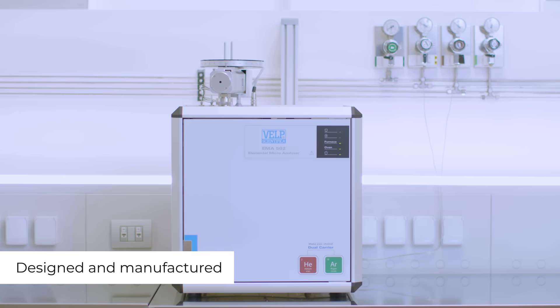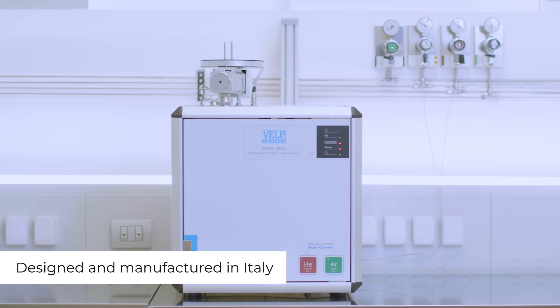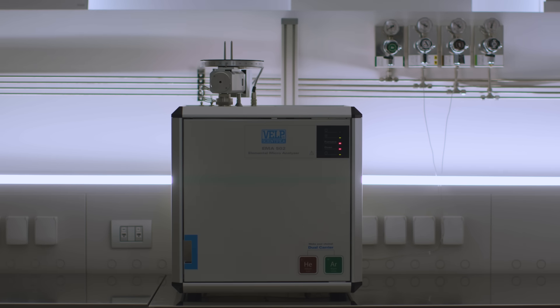VELP Scientifica EMA502 is the elemental analyzer designed just for you.